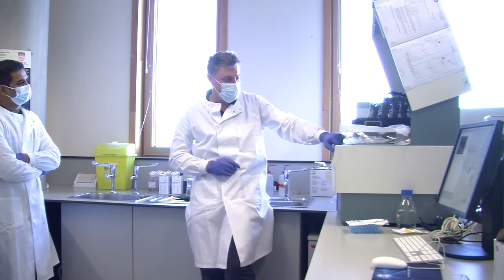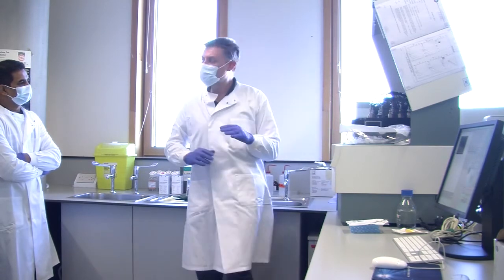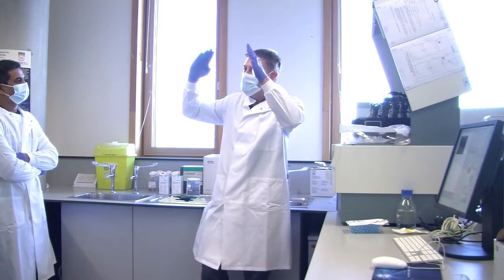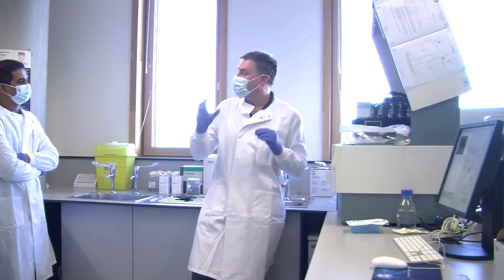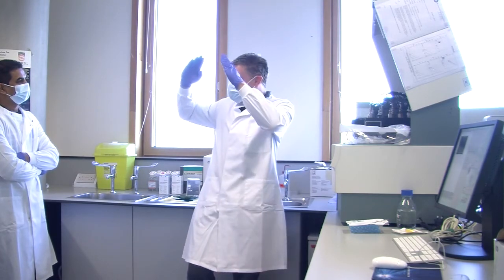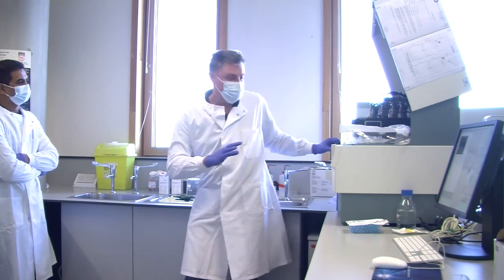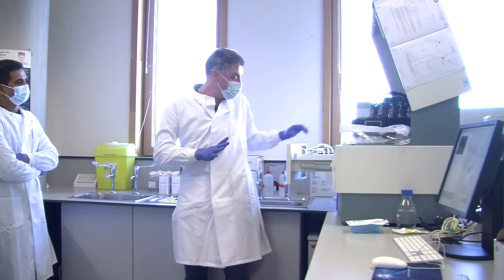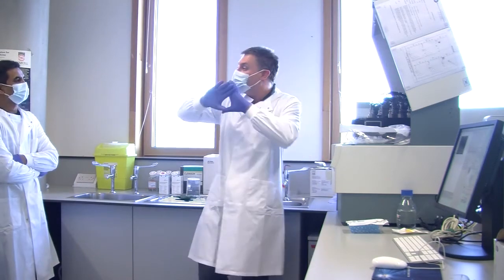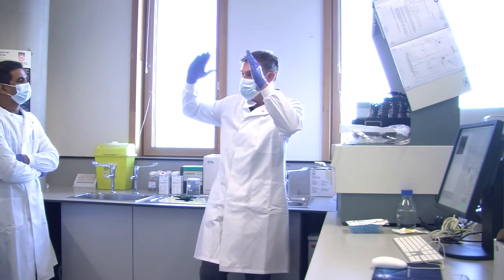Now you can't really see because of the tinted glass. But what there is in there is a little chamber shaped like that, because we want to look at one cell after another. So what we do is we feed our cells into that shape, and we feed sheath fluid. We feed PBS, which is in a tank here, around the outside of that V shape.